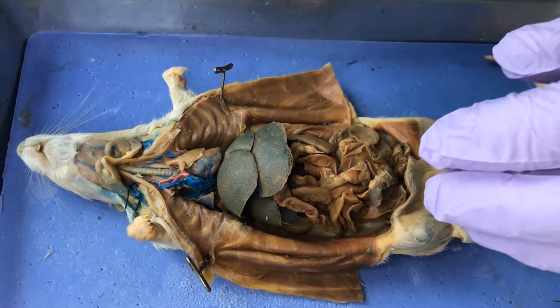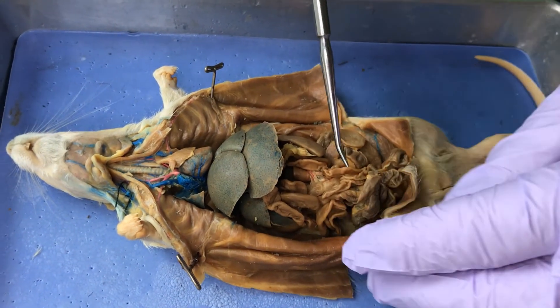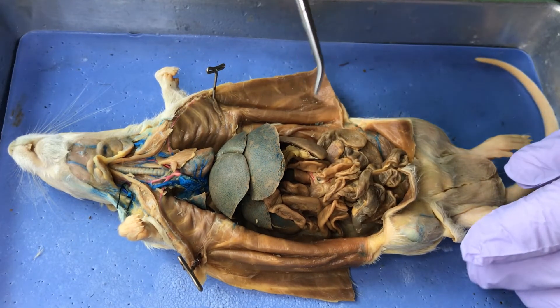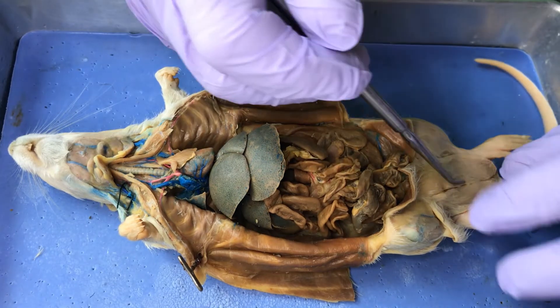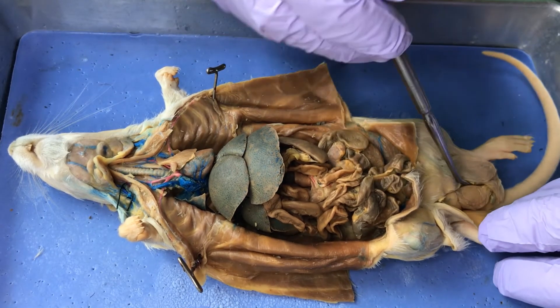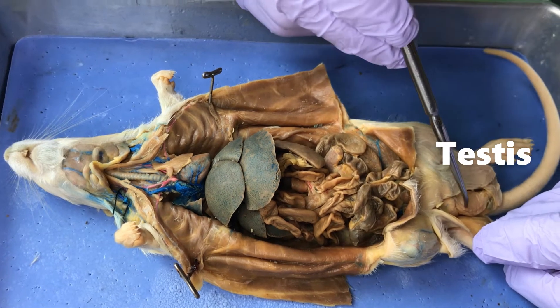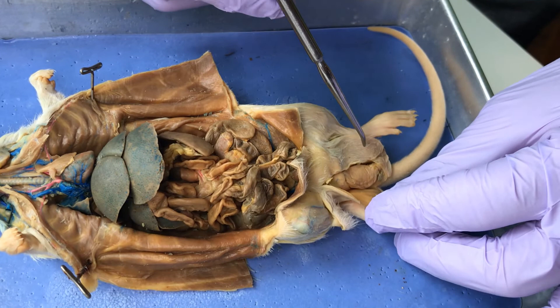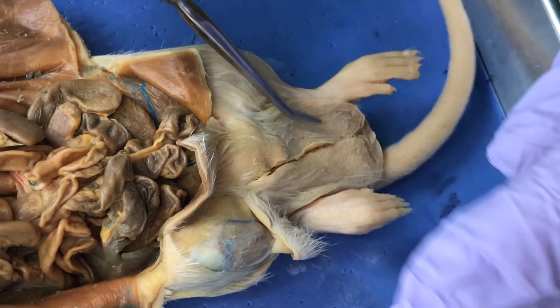Any little white blob you see at the top of the kidney is the adrenal gland. So I've covered: thyroid, thymus, pancreas, adrenal — and last, since this is a male rat, I've already cut open the scrotum and inside is one of the testes. Here are the testes of the rat; they're paired, of course.